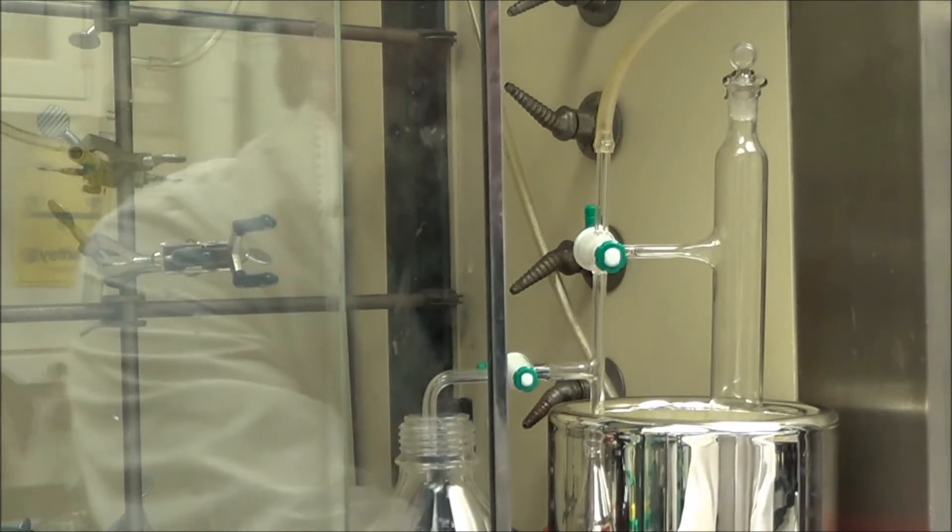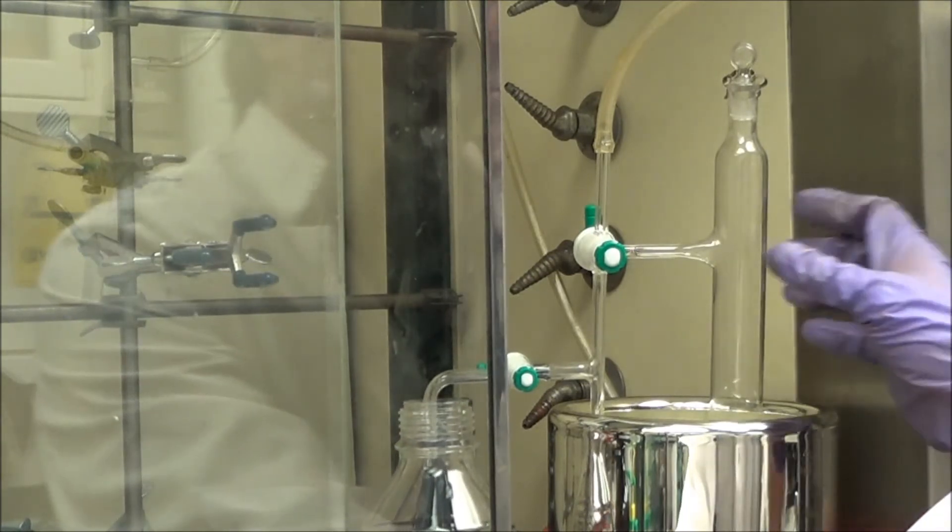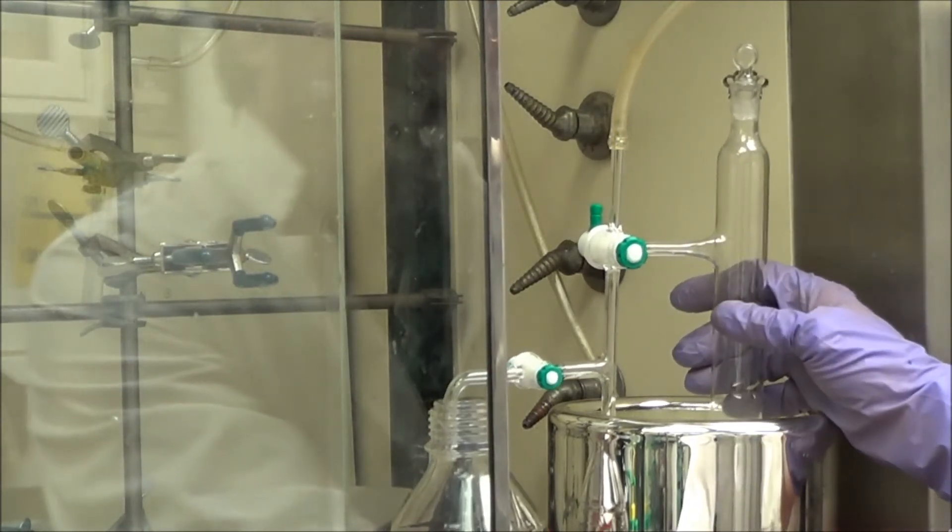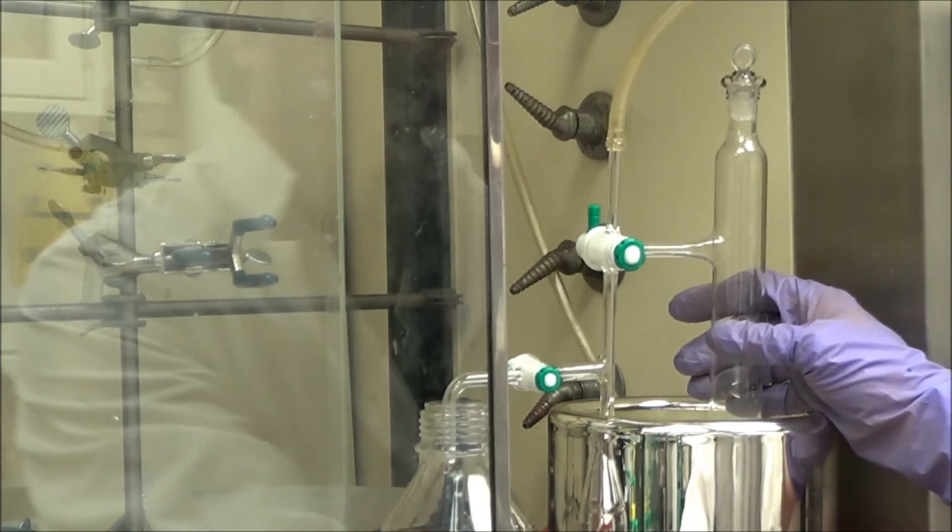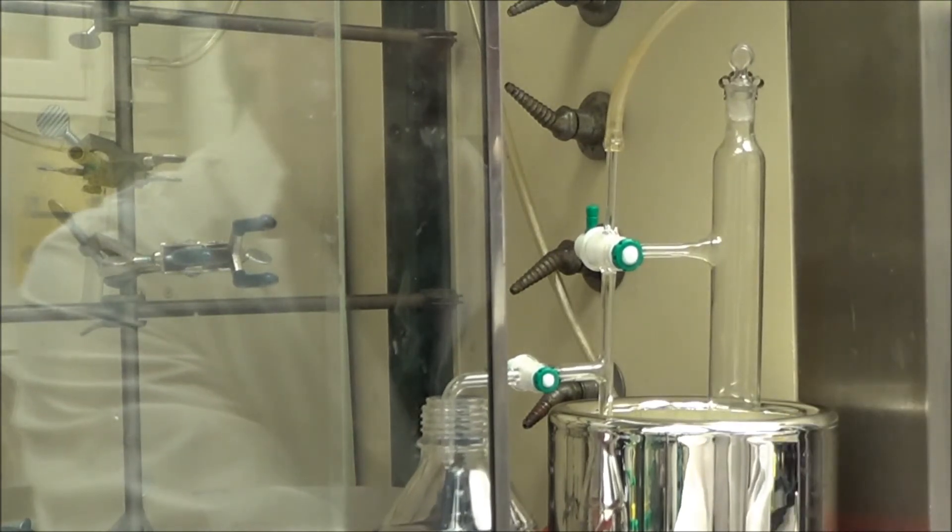But, I'm under no rush. Now, you're going to see that dramatically change on the second recrystallization, which is testimony to how many impurities are being removed by this recrystallization apparatus and procedure.